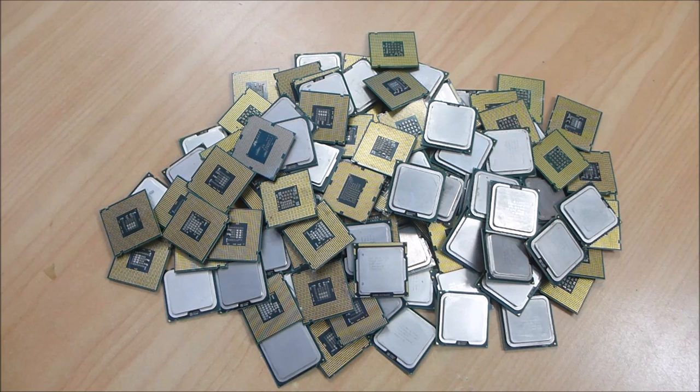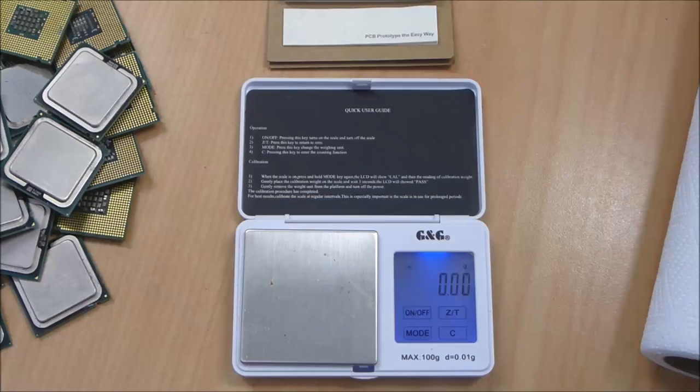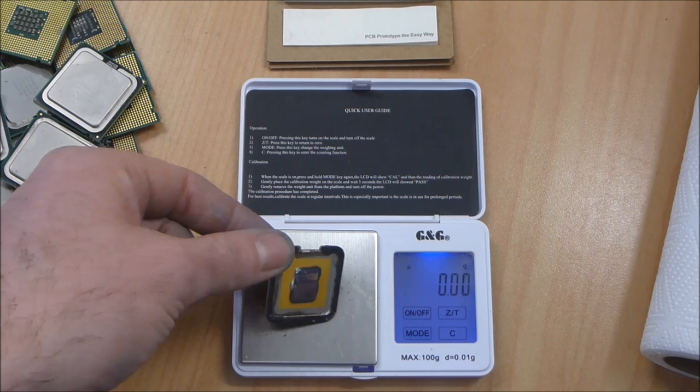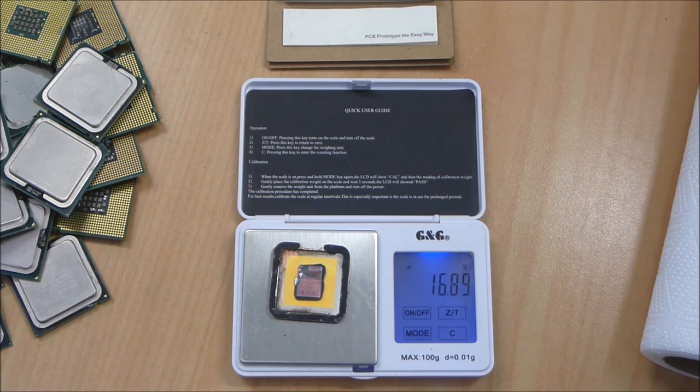I wanted to see what the copper value of a processor is. We end up with roughly 16.9 grams.